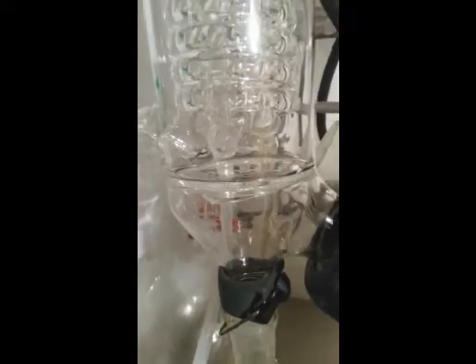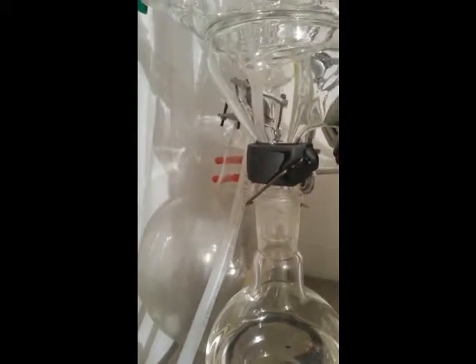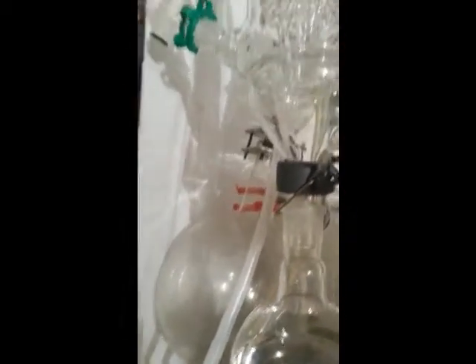Vacuum's off right now. You can see it slowing down. It's dropping back into the... It's going to go right back to zero right now. So we've been going down minus 5, minus 10, minus 15. Hold it about minus 20. It's about done, too. I got to get this out of the bag.